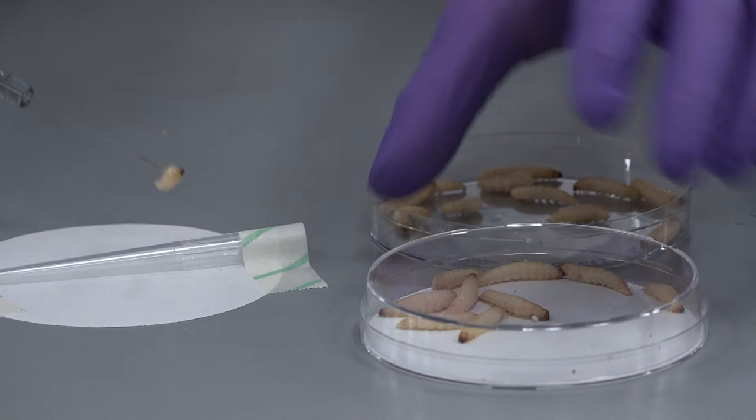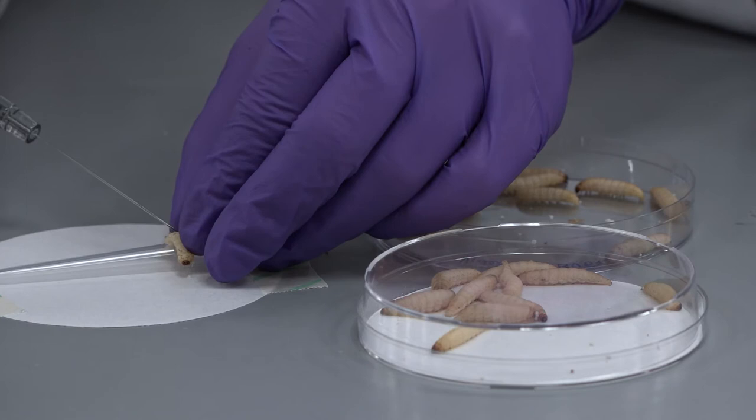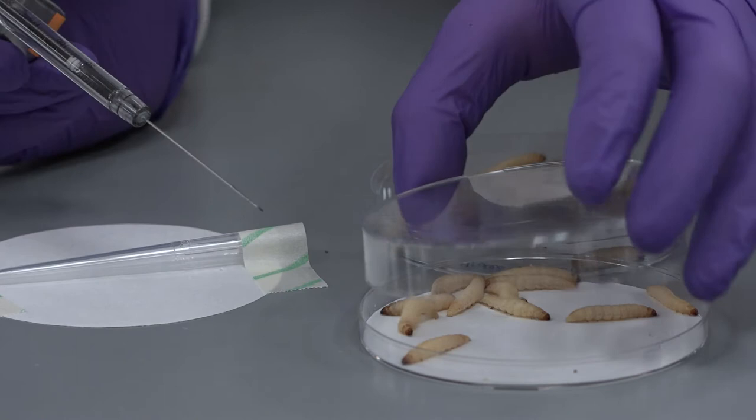Once you have decided on the doses of immunomodulator you are going to test based on your toxicity screen, you are now ready to inject your larvae following the basic injection technique learned previously. If you're doing a co-injection, you would first dose with your drug and then dose with your pathogen of choice.